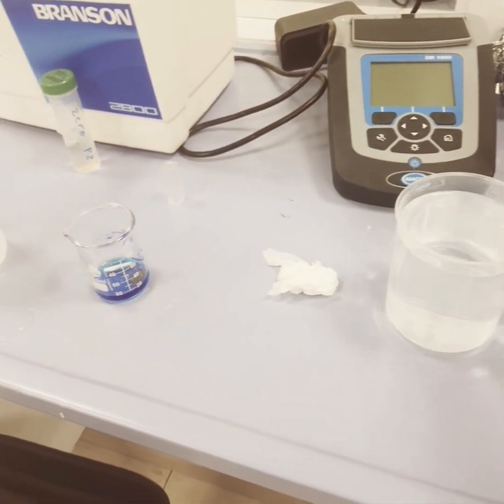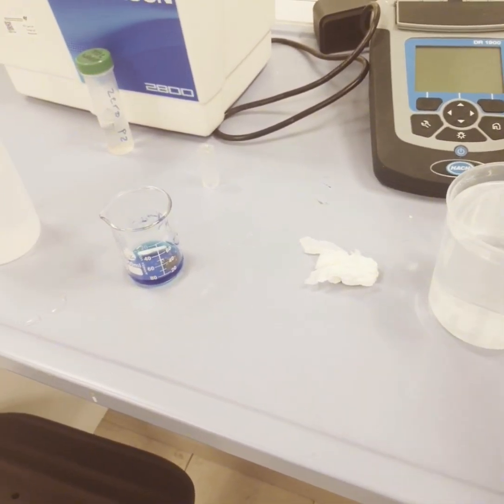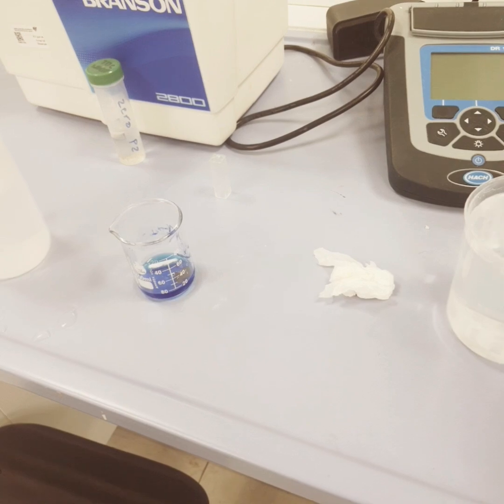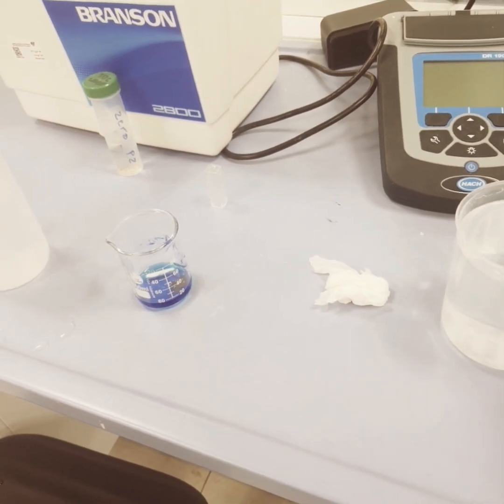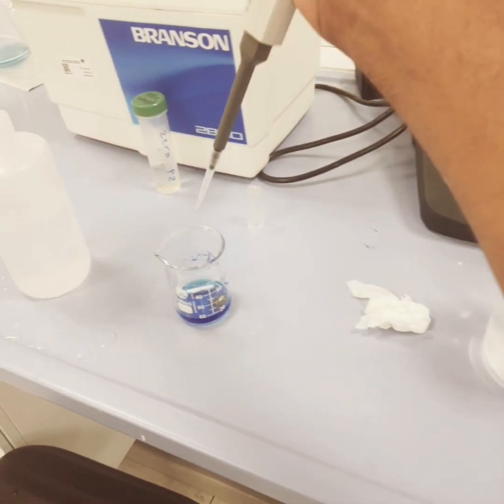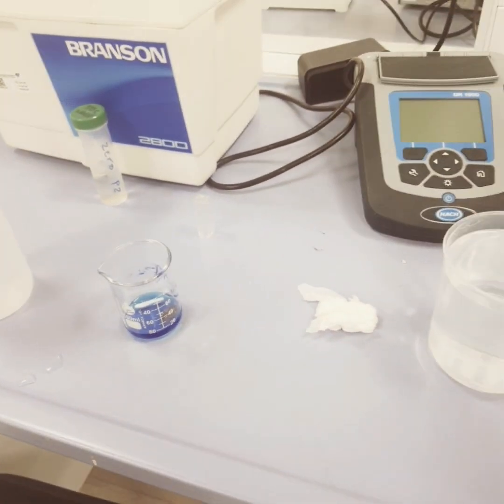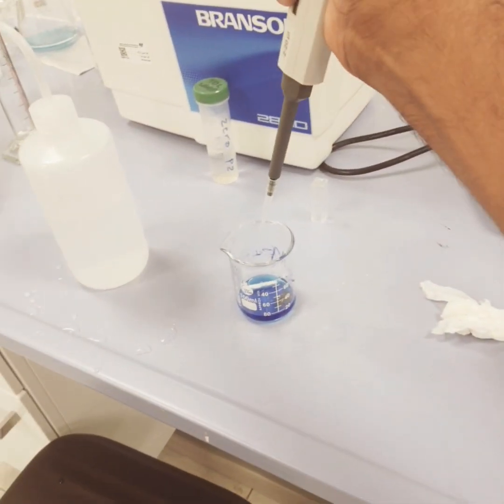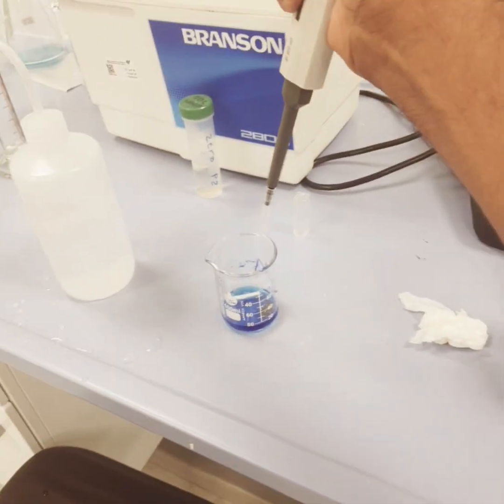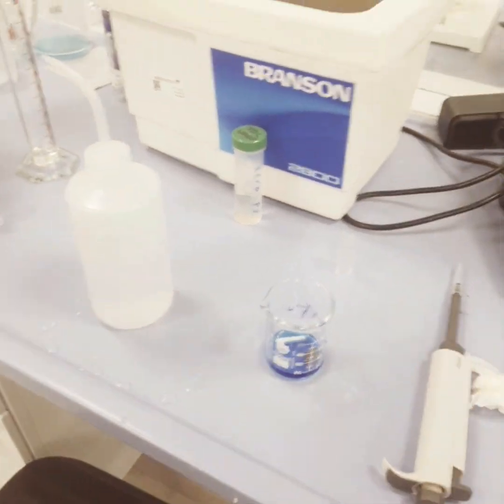Now we would just add a few drops here and then we will try to see the final concentration.